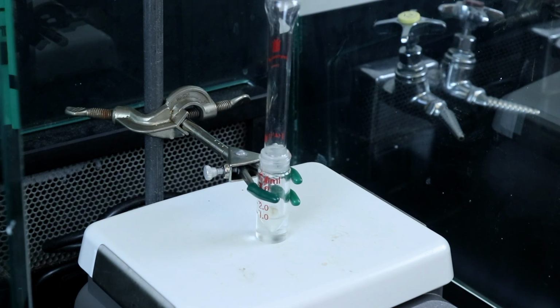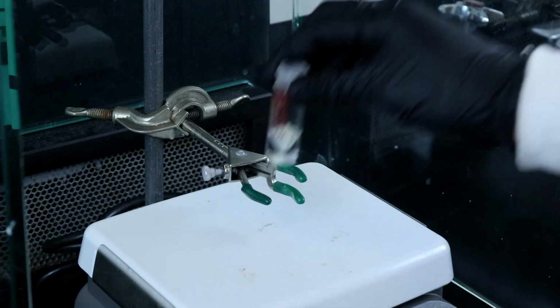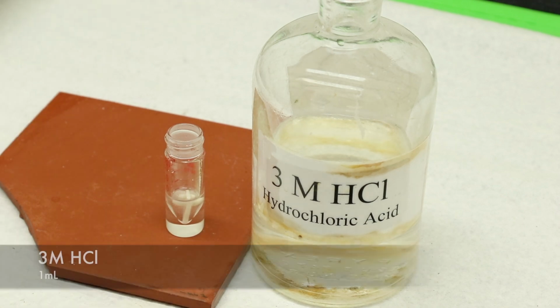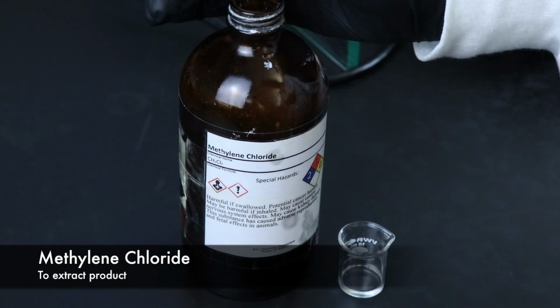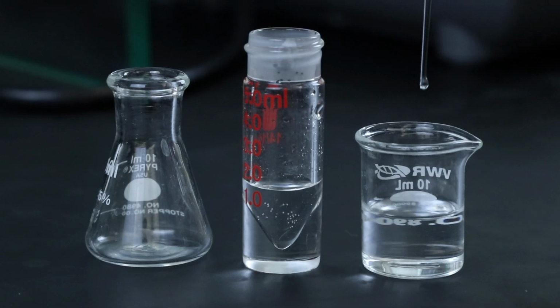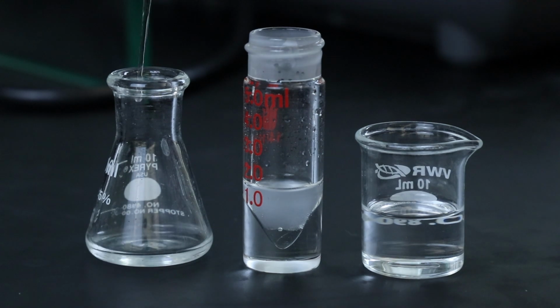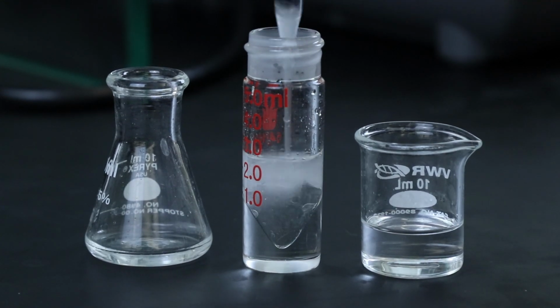After the hour reaction is done, I'll remove the air condenser and take the conical vial over to the hood, where I'll be adding about a milliliter of 3 molar hydrochloric acid. Then I'll get some methylene chloride in a beaker to perform the 3 extractions, and I'll make sure to mix the layers really well to extract as much product from that aqueous methanol solution as possible, combining all of the extracts into a separate Erlenmeyer flask.